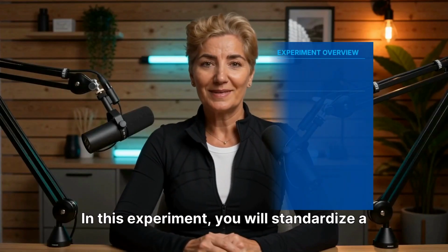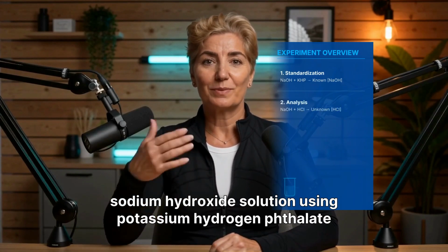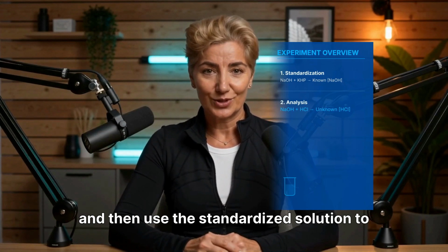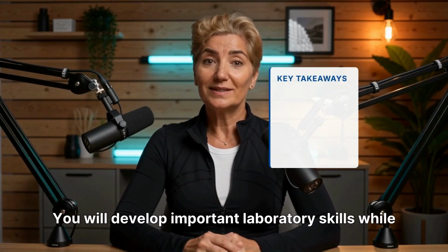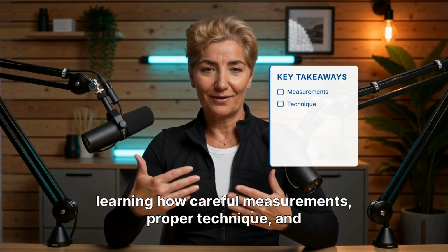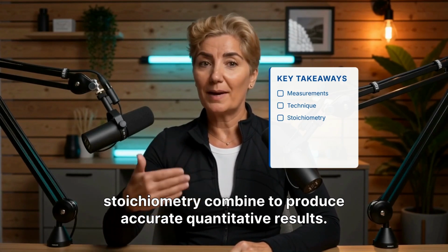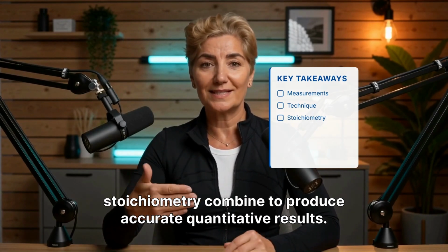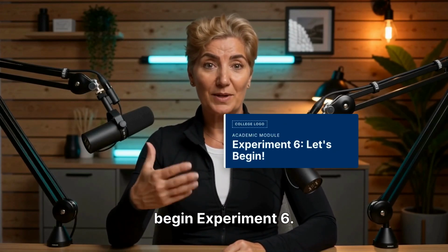In this experiment, you will standardize a sodium hydroxide solution using potassium hydrogen phthalate and then use the standardized solution to determine the concentration of an unknown hydrochloric acid solution. You will develop important laboratory skills while learning how careful measurements, proper technique, and stoichiometry combine to produce accurate quantitative results. Now that we've covered the basics, let's begin Experiment 6.